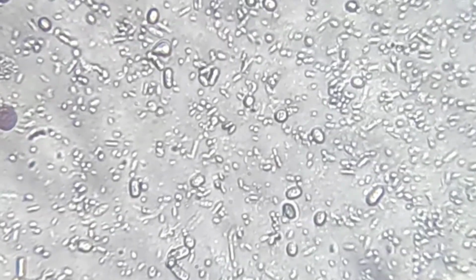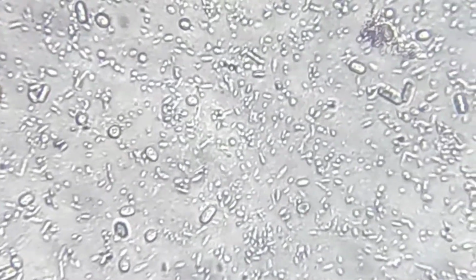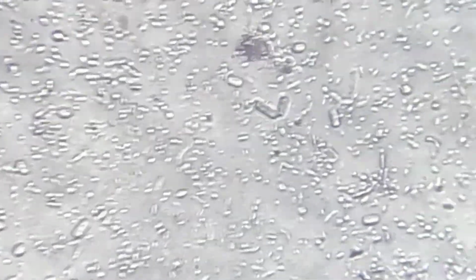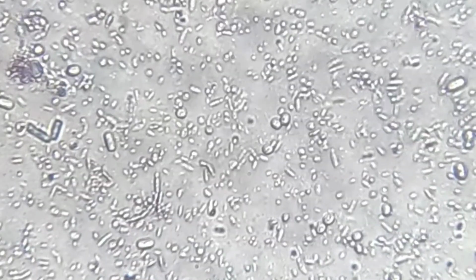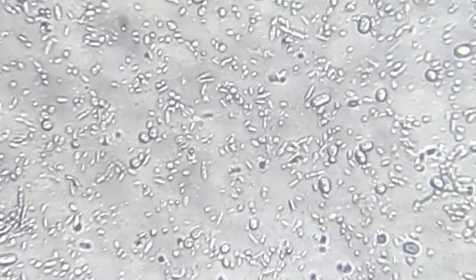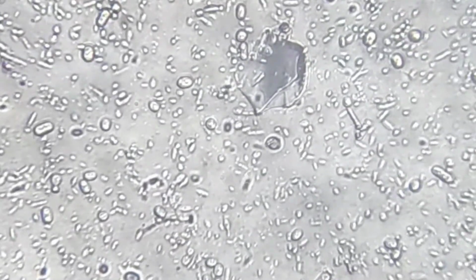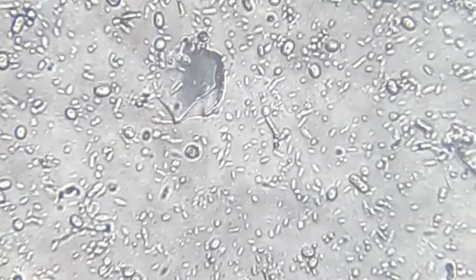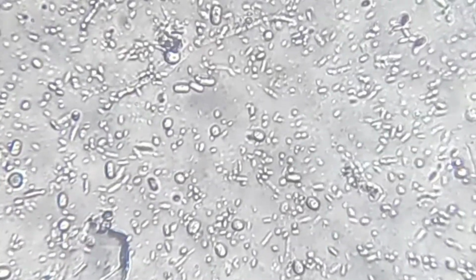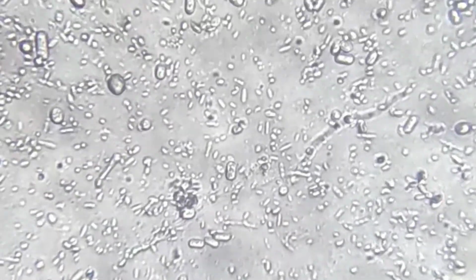So inside this one drop of rotten grape juice, we are actually seeing a complete microscopic community. Large oval-shaped yeast performing fermentation, tiny round and oval bacteria involved in spoilage, the rod-shaped bacilli breaking down the fruit, all working together, eating the sugars, producing gases and changing smell and texture. Something that looked like simple rotten fruit to the naked eye becomes under the microscope a busy living ecosystem.